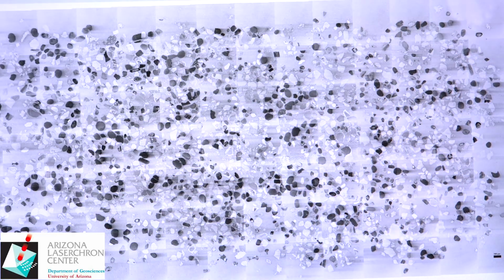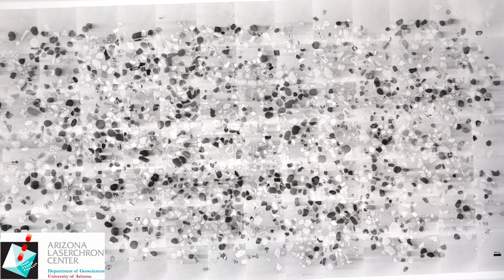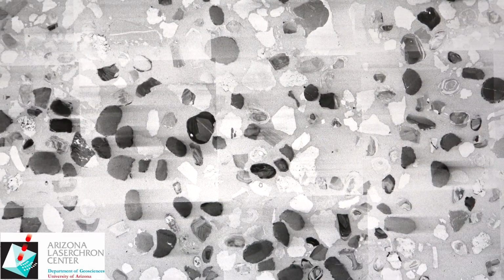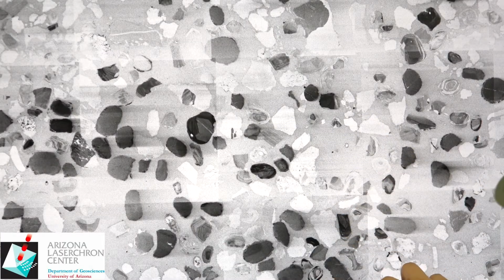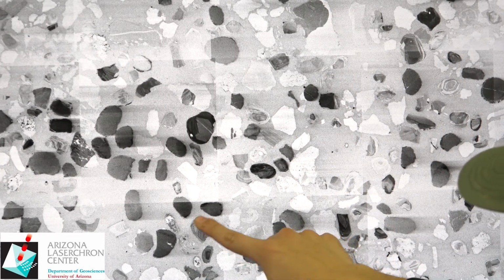We just invert it, make it black and white, and again the same principle of just saving printer ink and making a more crisp image in black and white. So if we zoom into that similar area, we will be able to see very similar trends that we saw in the colored version. We can see the oscillatory zonation, or the pretty typical zoning of a zircon, which you can see here. This is also pretty typical zircon zonation.